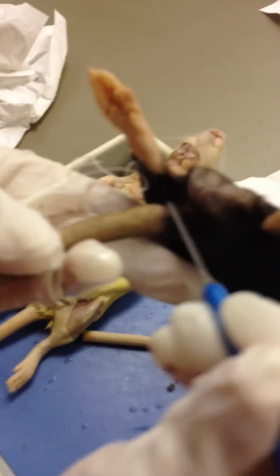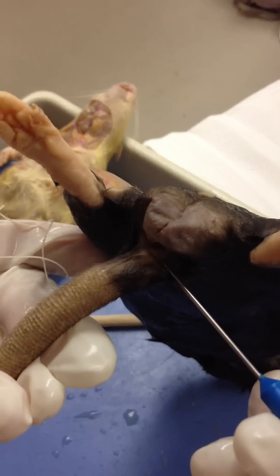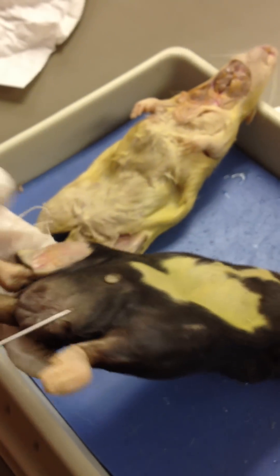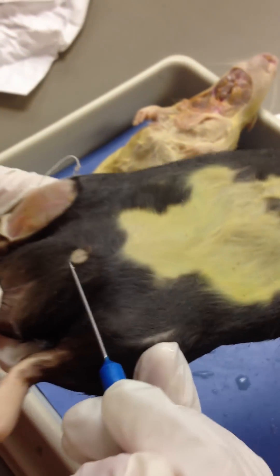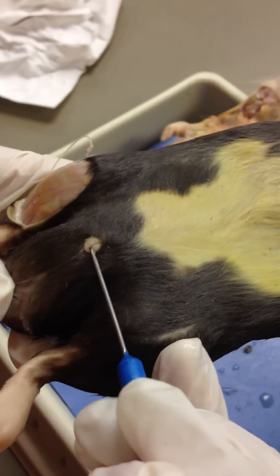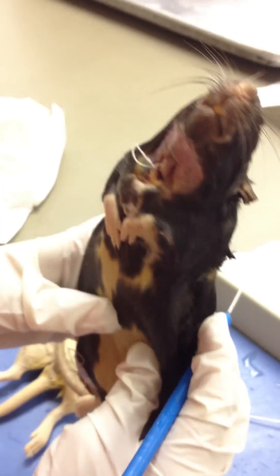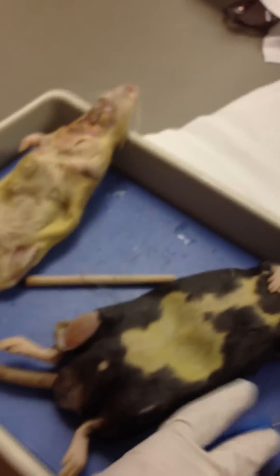For males, the anus is underneath right there at the base of the tail. Your scrotum with testes. And that's your male urethra. That's it for the external features.